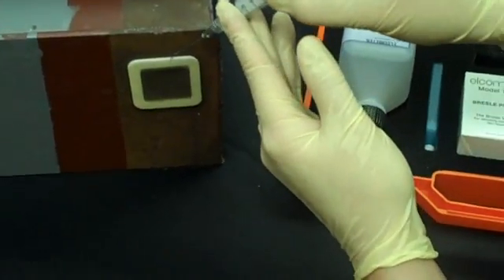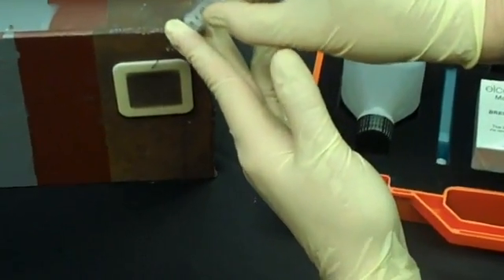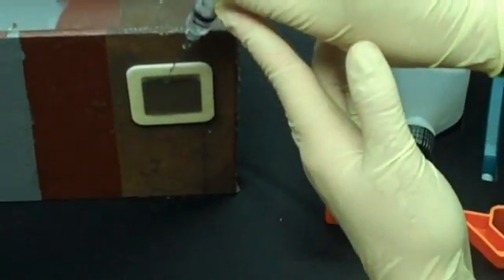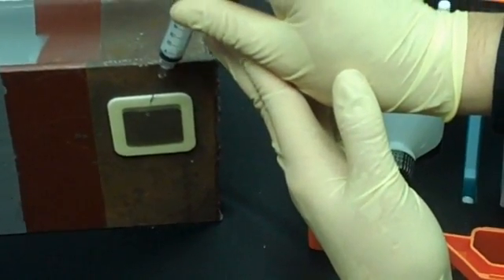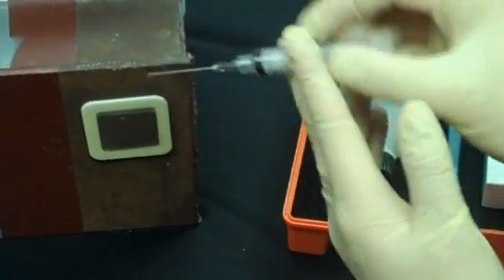Then reinsert the syringe and place the remaining deionized water into the patch. Now the patch should be almost full.